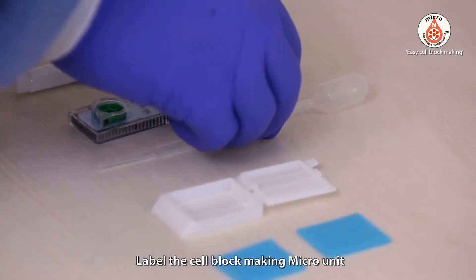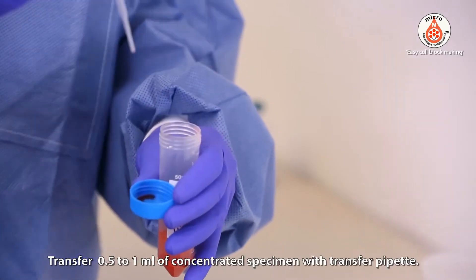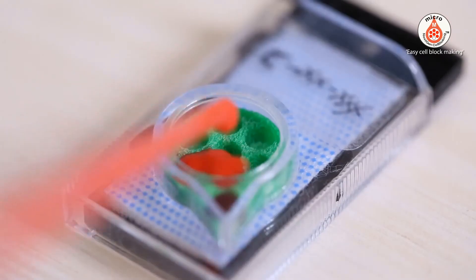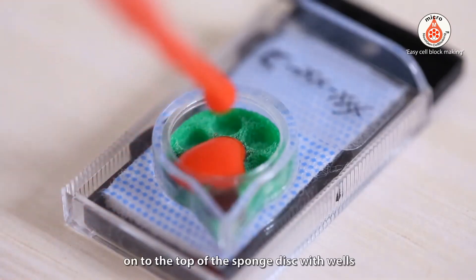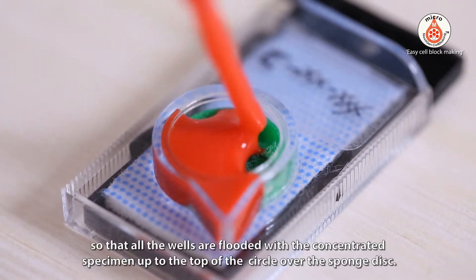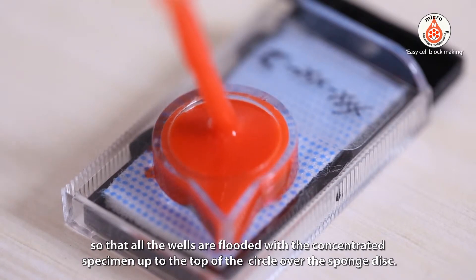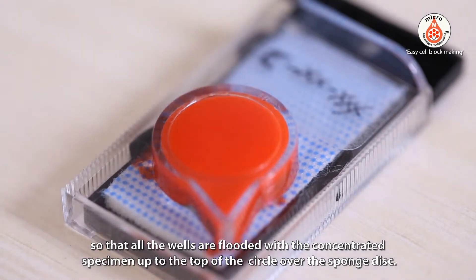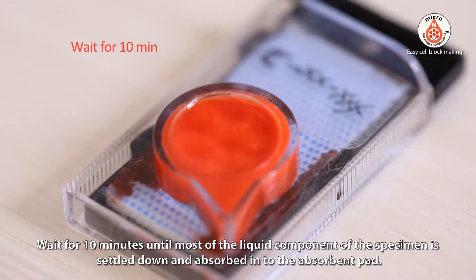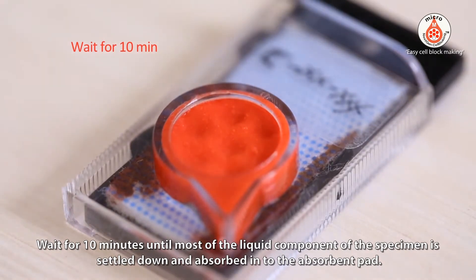Label the cell block making micro unit. Transfer 0.5 to 1 ml of concentrated specimen with a transfer pipette onto the top of the sponge disk with wells, so that all the wells are flooded with the concentrated specimen up to the top of the circle over the sponge disk. Wait for 10 minutes until most of the liquid component of the specimen has settled down and been absorbed into the absorbent pad.